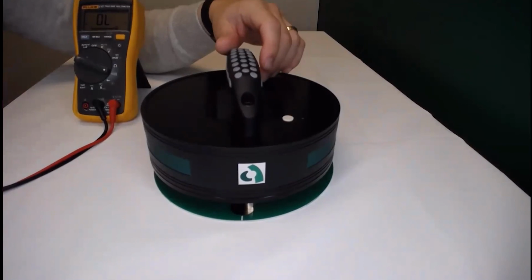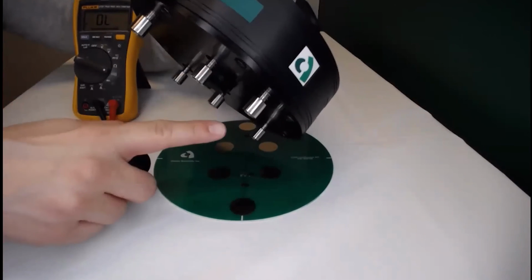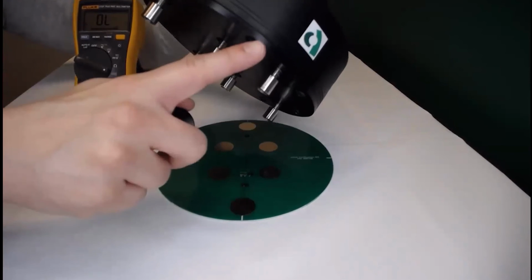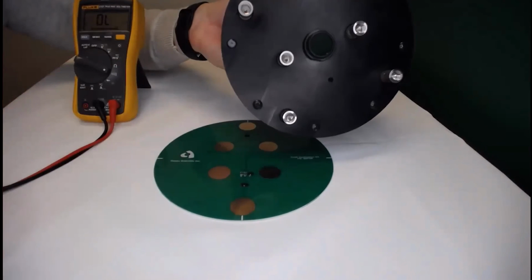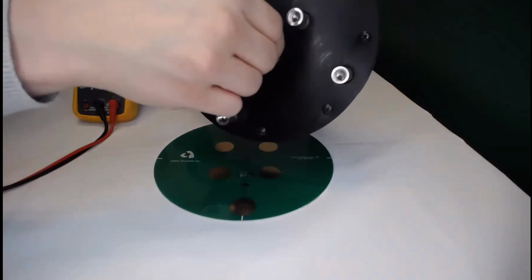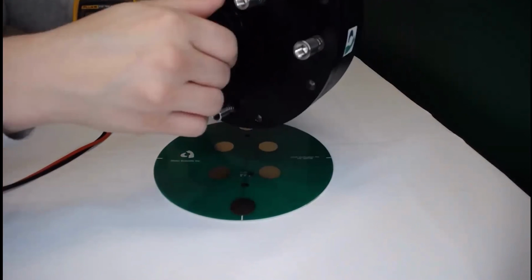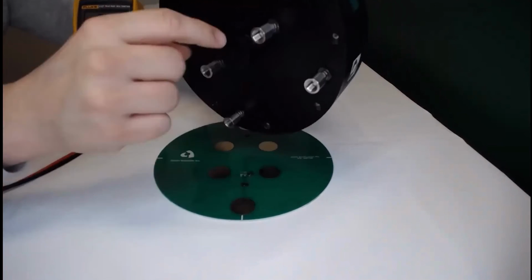This process is only done for the verification procedure in which you're not using sponges. So it's metal versus metal, and that's why this process of removing the cap might help. After you've done this process, you can just put the cap on again to make sure that we don't lose moisture on our inner half cell electrode.